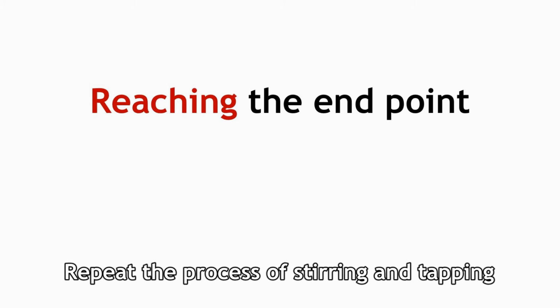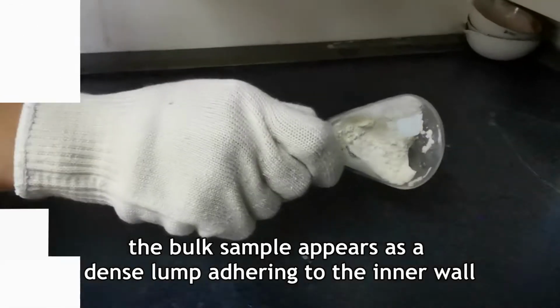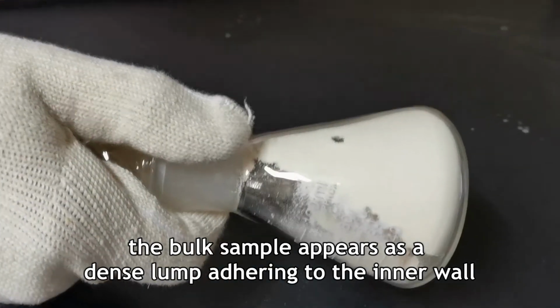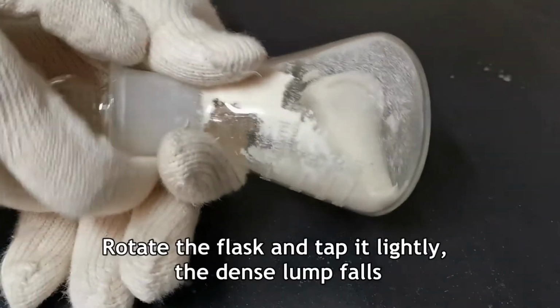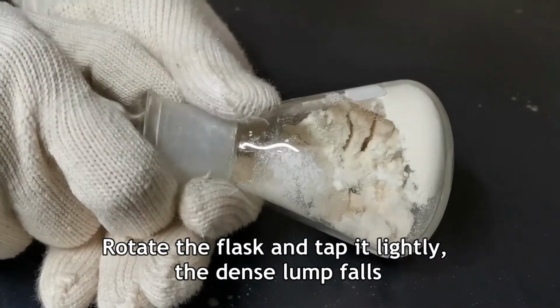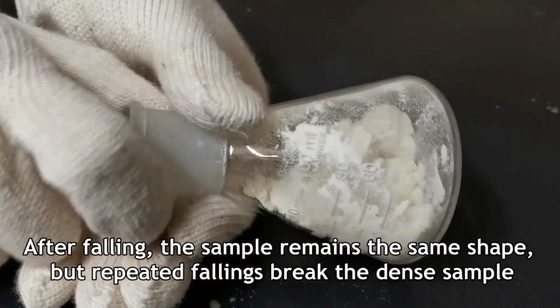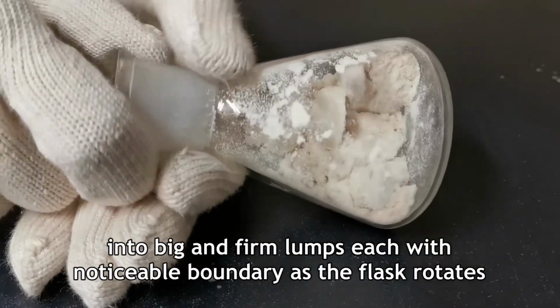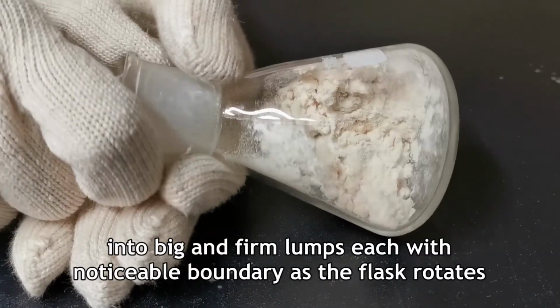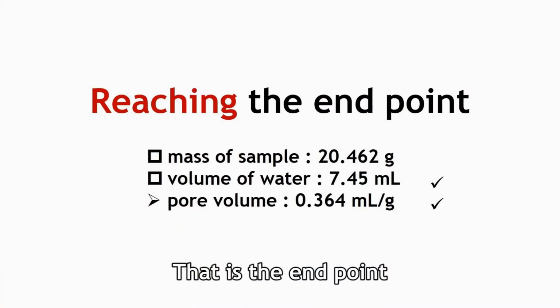Repeat the process of stirring and tapping. In this video, after 7 drops of water are added, the bulk sample appears as a dense lump adhering to the inner wall. Rotate the flask and tap it lightly. The dense lump falls. After falling, the sample remains the same shape, but repeated fallings break the dense sample into big and firm lumps, each with noticeable boundary as the flask rotates. That is the end point.